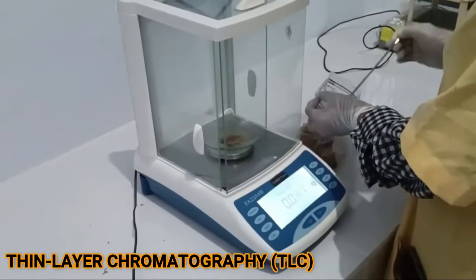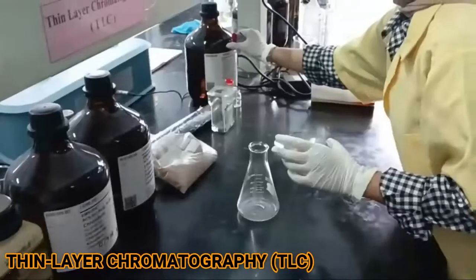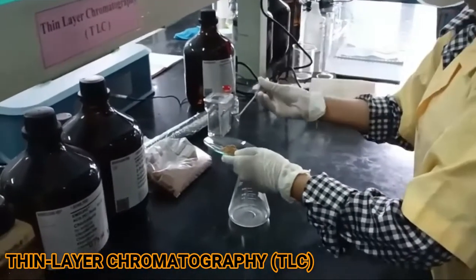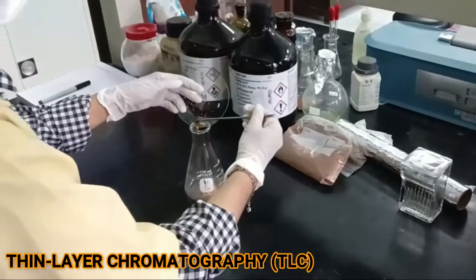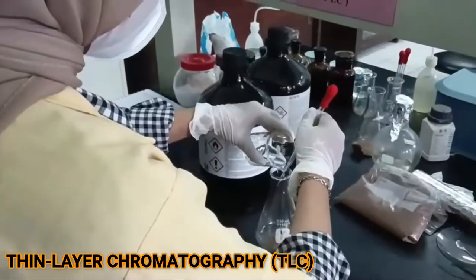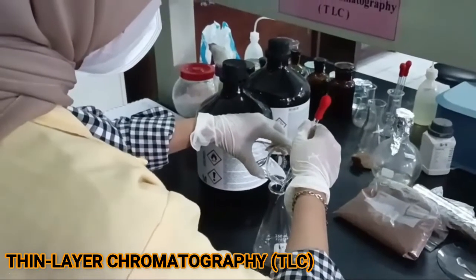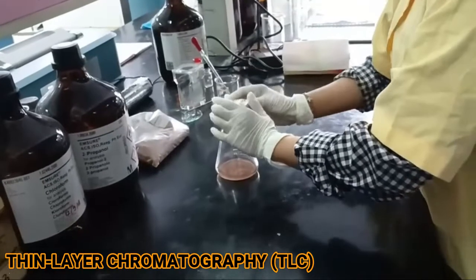TLC experiment is one of the experimental units of analytical chemistry and organic chemistry practicum. The aim is that students have skills in separating organic and inorganic compounds. The procedures in this experiment are sample weighing, extraction, evaporation, and finally the TLC test. This practicum supports courses in analytical chemistry, biochemistry, and organic chemistry.